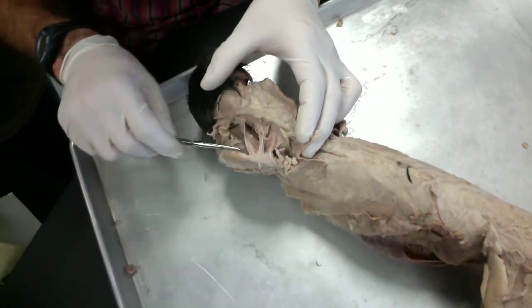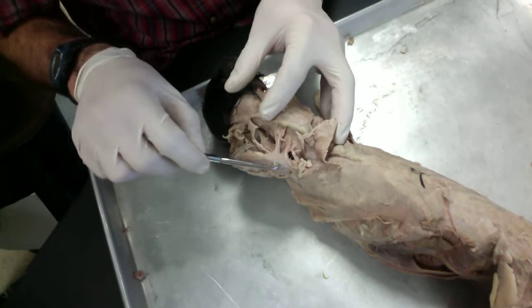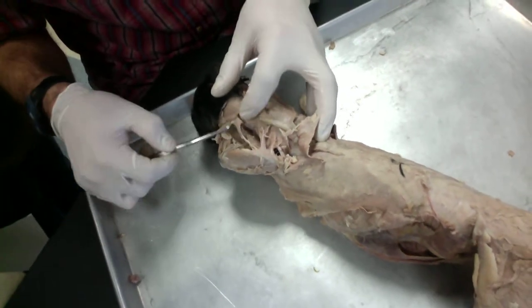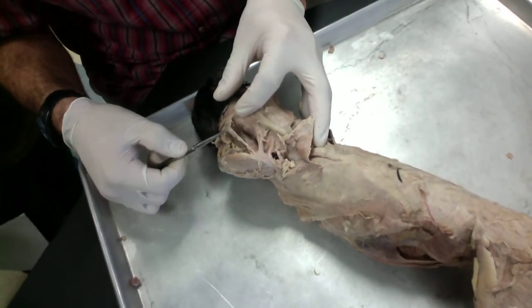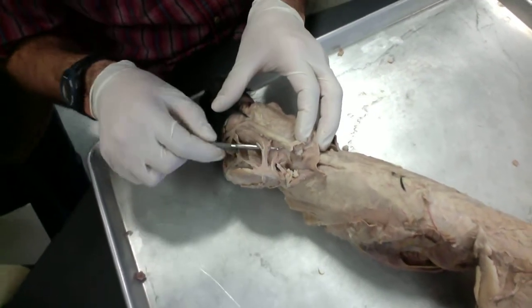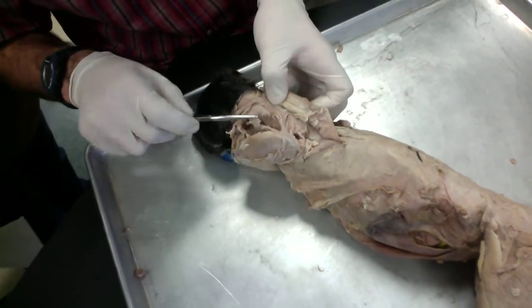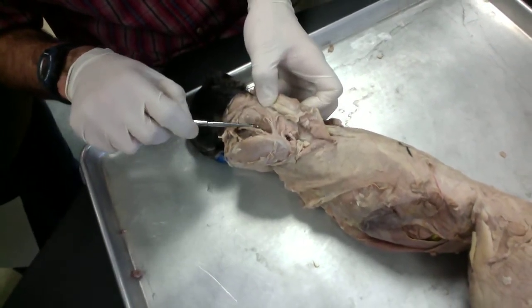And then we've got this filament that comes across from the back of the shoulder blade up to the neck. This is our rhomboideus capitis. And then these several muscles that are going straight across, these are our rhomboideus. And then here, this big, large neck muscle is our splenius.